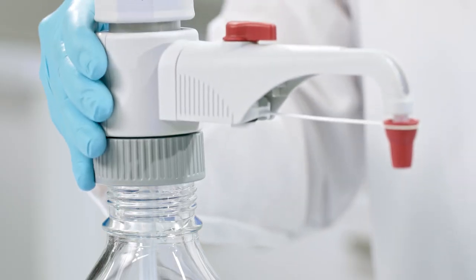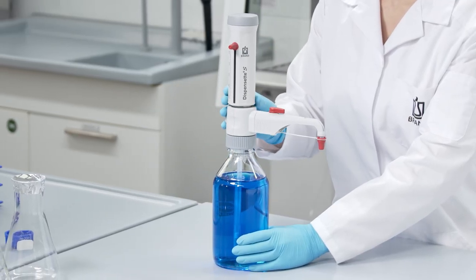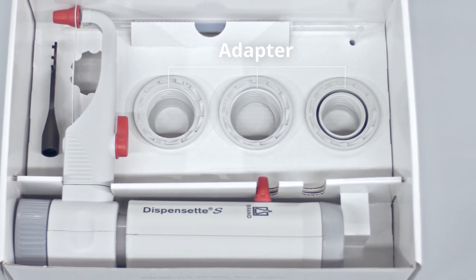Now simply mount the instrument GL45 threads onto your reagent bottle. For bottles with other thread sizes, select a suitable adapter.